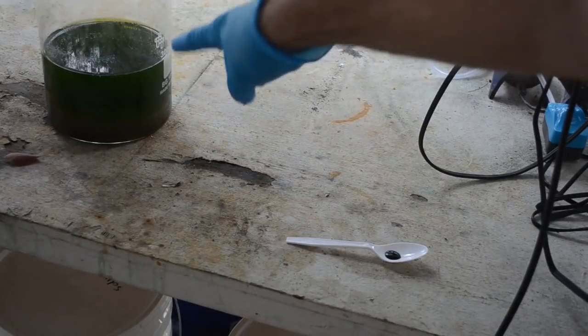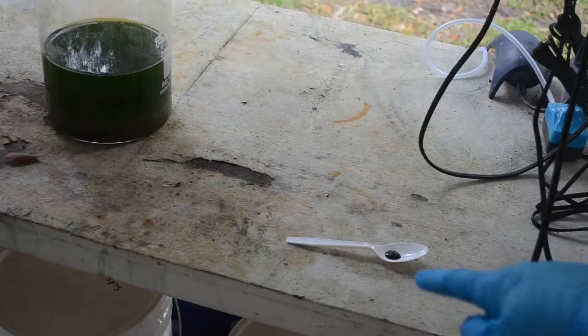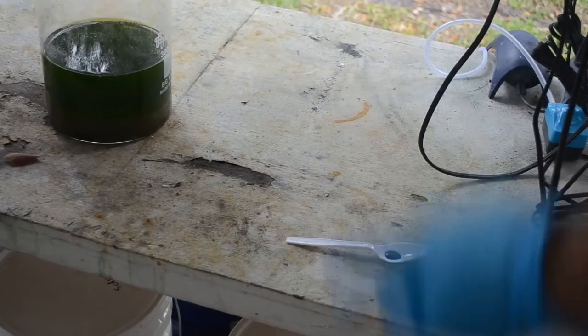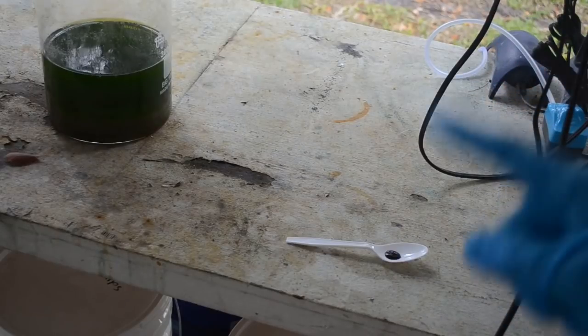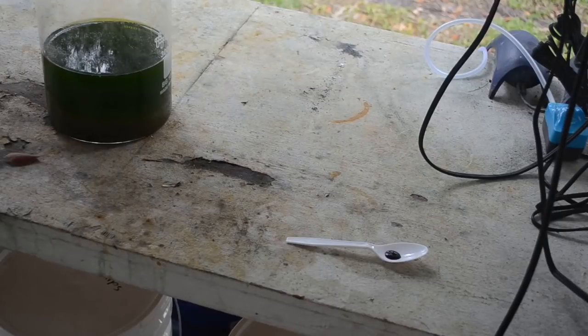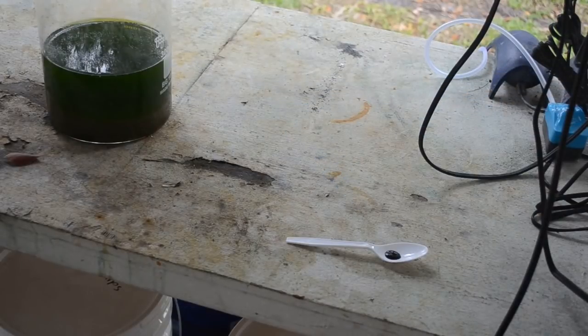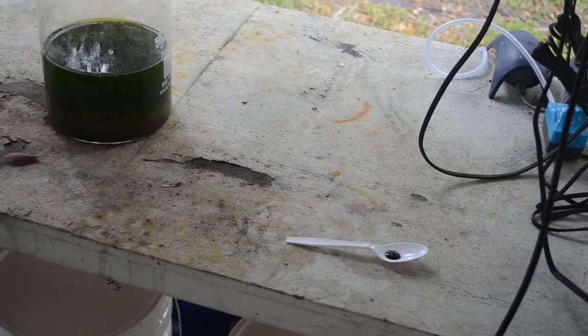Well, I just did another stannous chloride test on this stuff. So we definitely got gold in solution. It's a pretty good indication. So there's a fair amount of gold in there. I just don't think we have it all in solution. I was just gonna decant that off, but I'm thinking I might as well filter it. And I can drop the gold out of what liquid I've got here and then start a second extraction on the stuff in the bottom of the beaker.